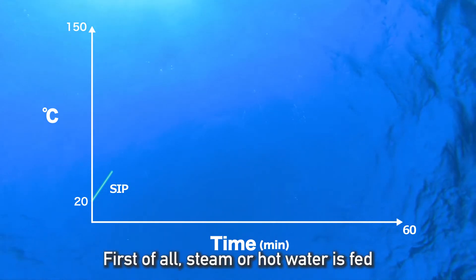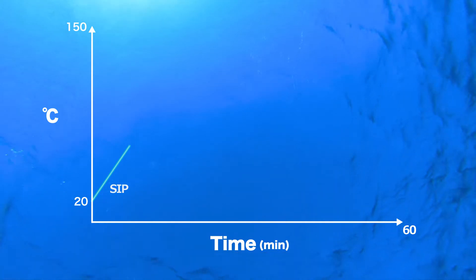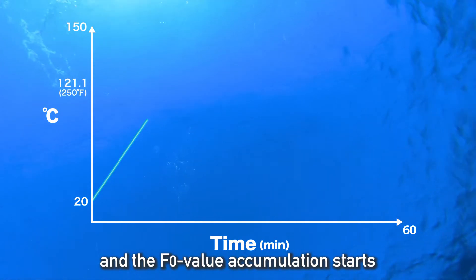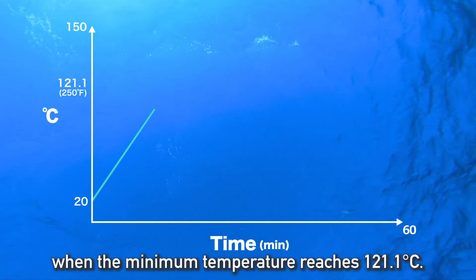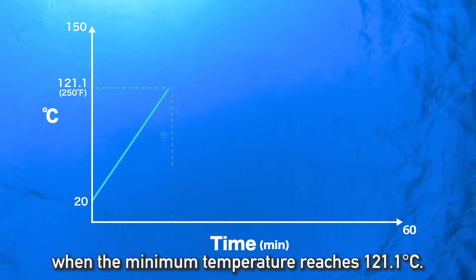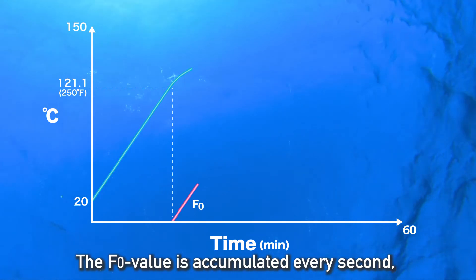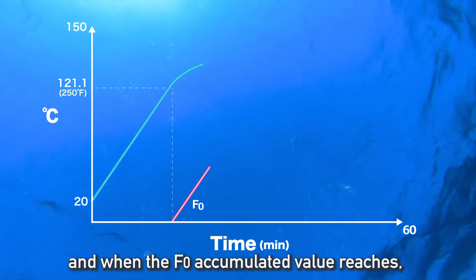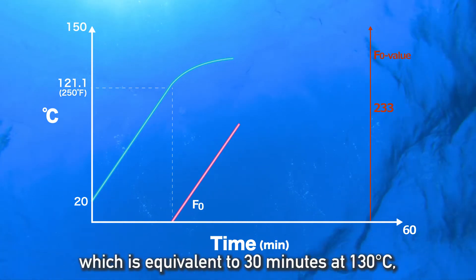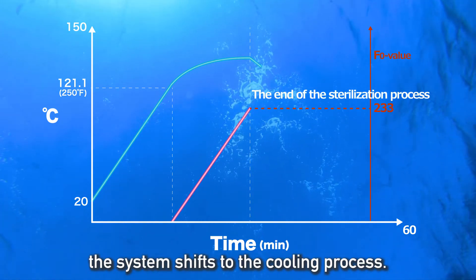First of all, steam or hot water is fed into the pipes to start the SIP. The thermometer in the aseptic zone rises, and the F-sub-O value accumulation starts when the minimum temperature reaches 121.1 degrees Celsius. The F-sub-O value is accumulated every second, and when the F-sub-O accumulated value reaches, for example, 233 — which is equivalent to 30 minutes at 130 degrees Celsius — the system shifts to the cooling process.